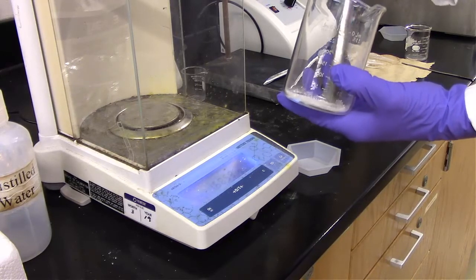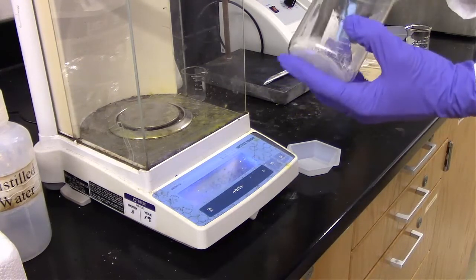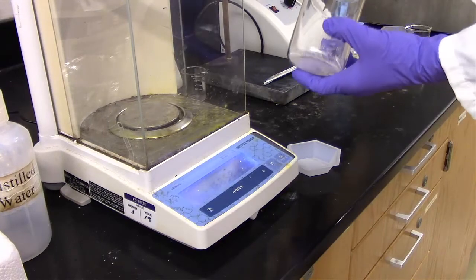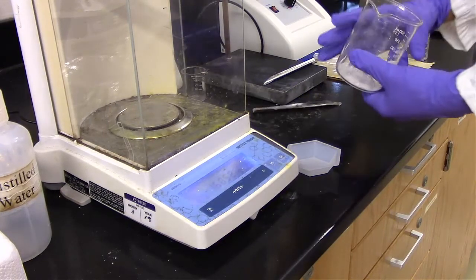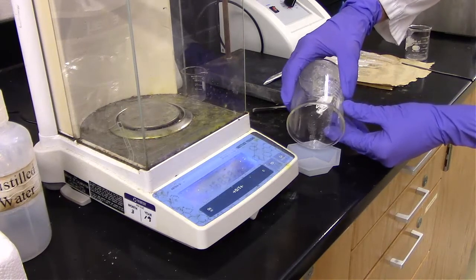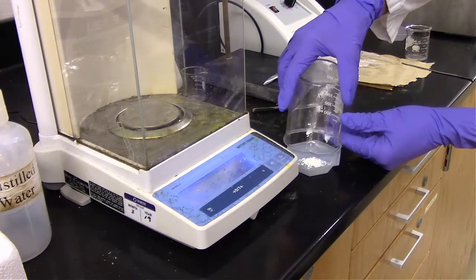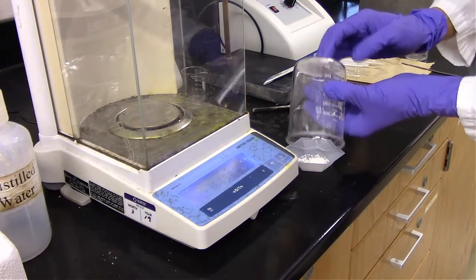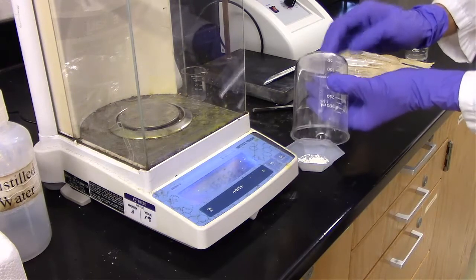Again, like I talked about before, the decanting process, especially after we washed it with water that first time, that was a little bit fast. We probably should have let it sit a little bit longer. We're just running out of recording time for this. So I expect our yield to be pretty low.